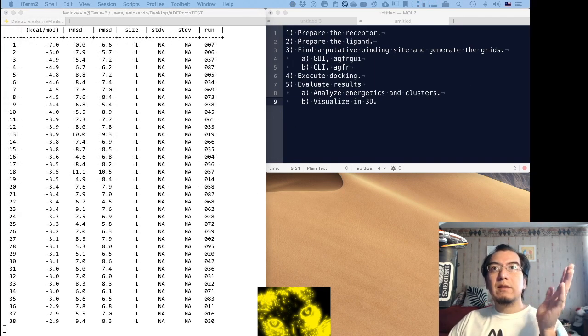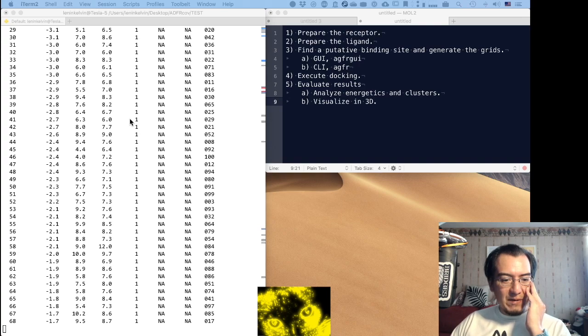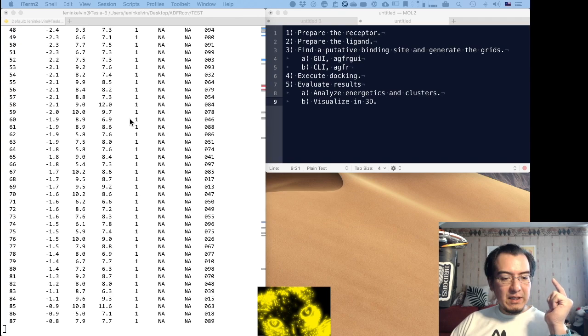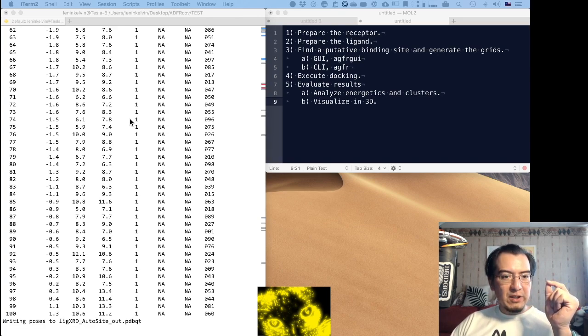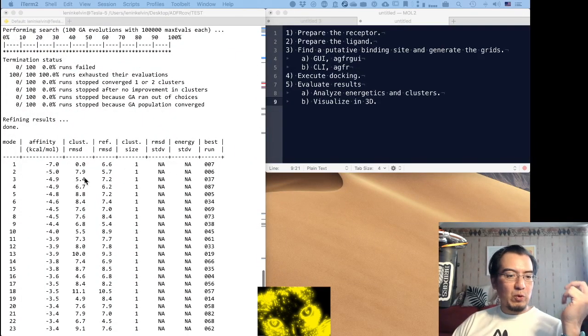Okay, the results are coming in, and as you can see, the problem is fairly difficult, as even with this number of runs and evaluations, seemingly each result is a cluster on its own. Yep, a total of 100 clusters. So this clearly shows, yep, we don't have statistics.